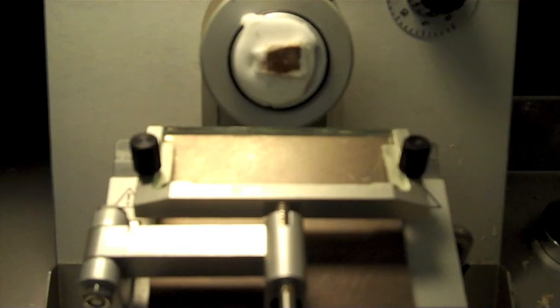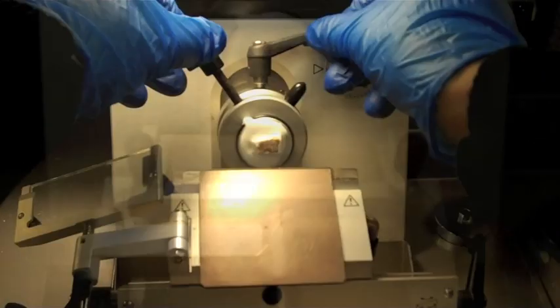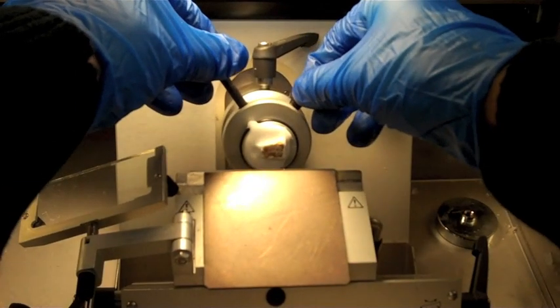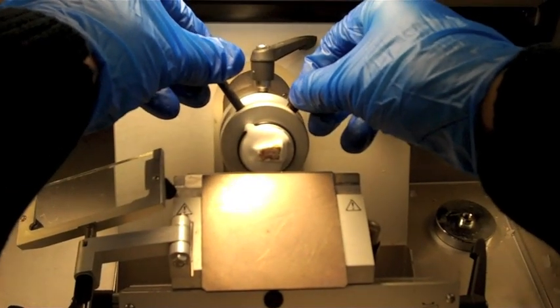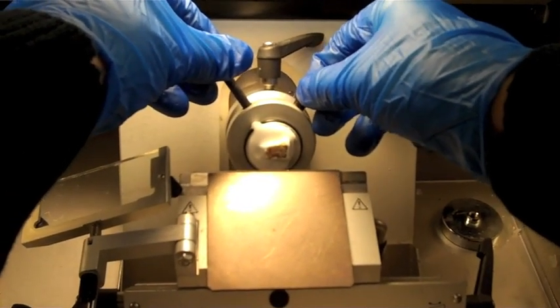The blade is very sharp. For your protection, make sure to put the faceplate over the blade when your hands are near it. If needed, you can alter the angle of the specimen while it is mounted.